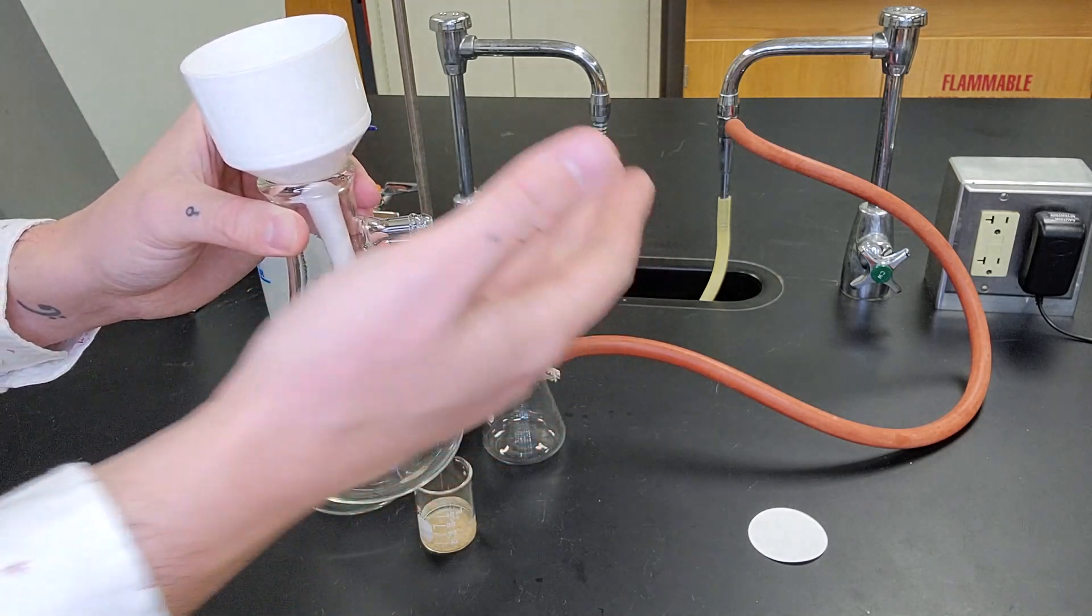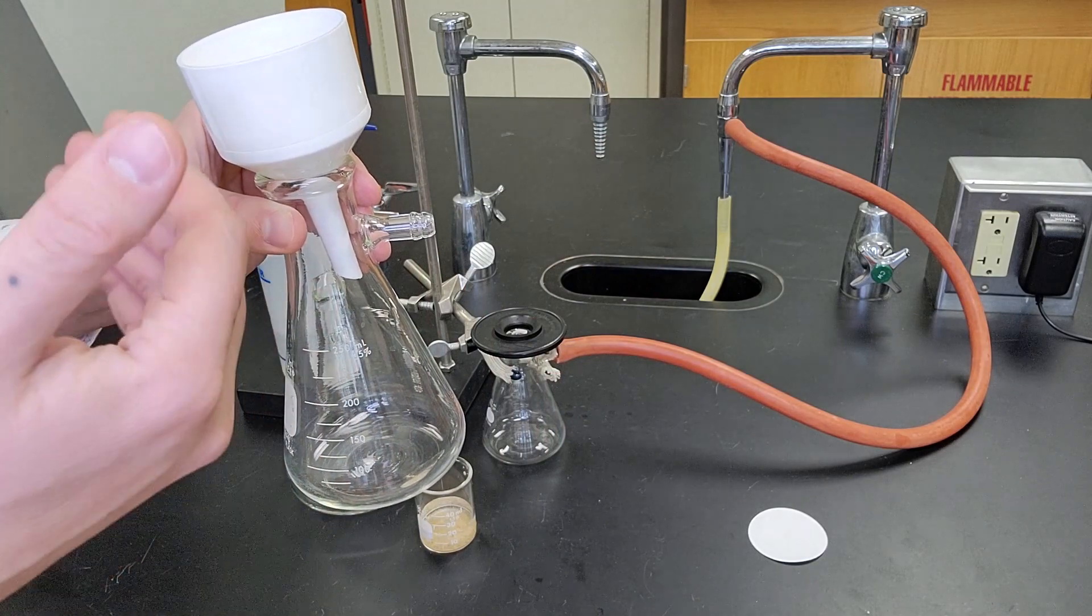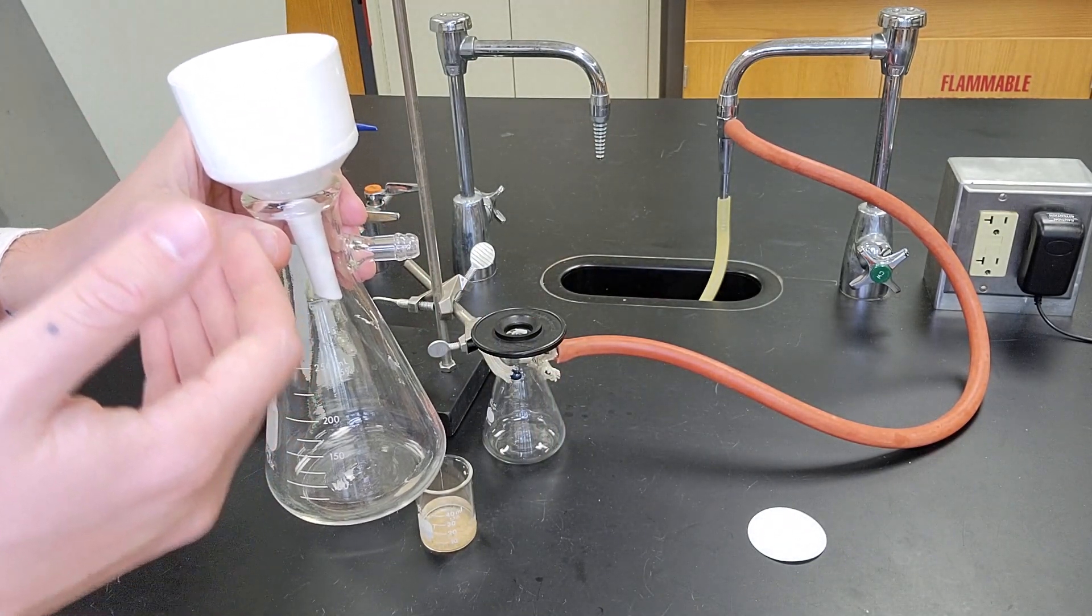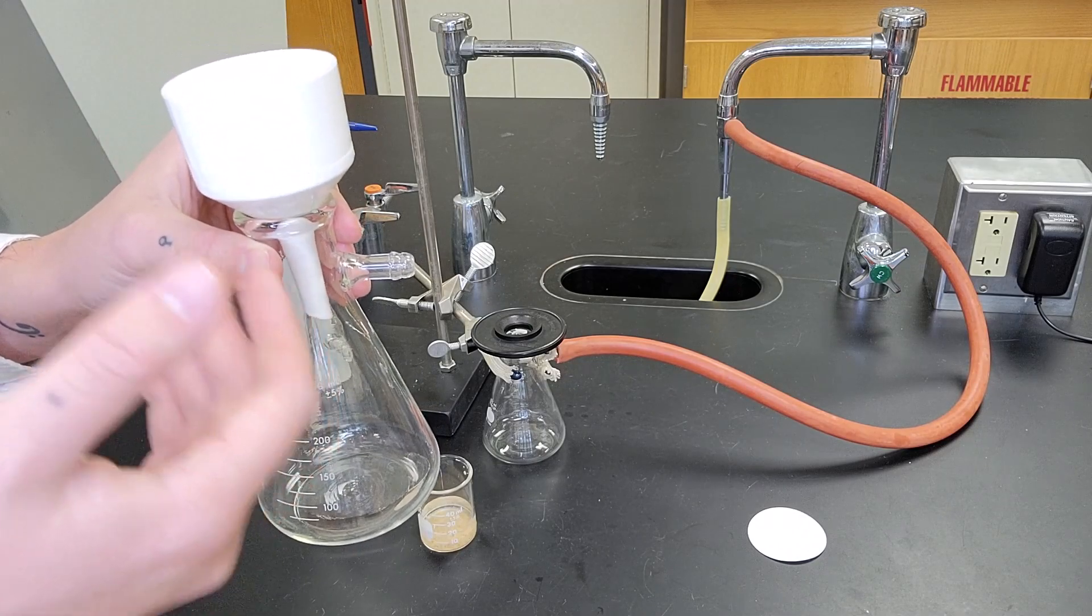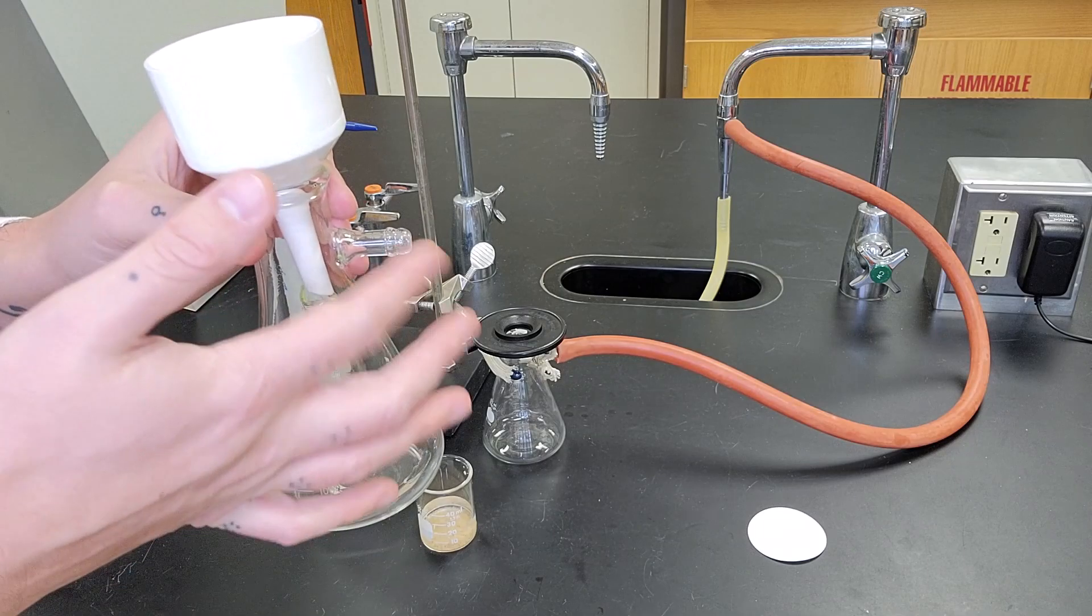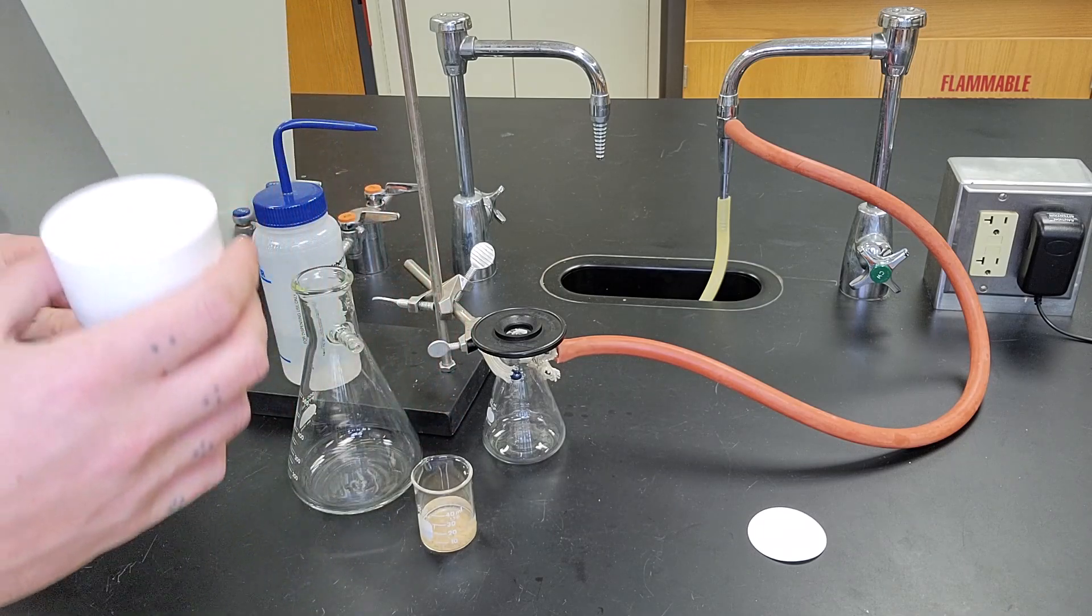Again, for these labs where we're using water pressure to create the vacuum, not so much of an issue. But in labs where you're doing high vacuum filtration, you would want to make sure that this opening is pointing away from the sidearm to avoid sucking in liquid.